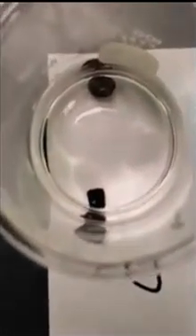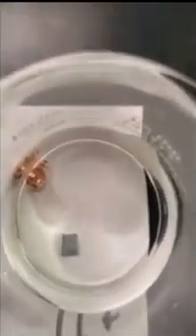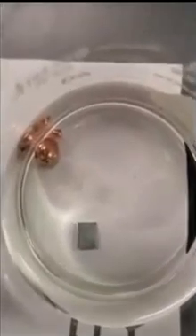So again, here's what the zinc metal by itself looks like. And this is in the solution of silver. There's the copper at the top, there's the zinc, and then there's the zinc on the bottom. Does not look like this anymore. And then here's our copper metal in the solution of zinc ions. And here is our two metals in the hydrochloric acid.